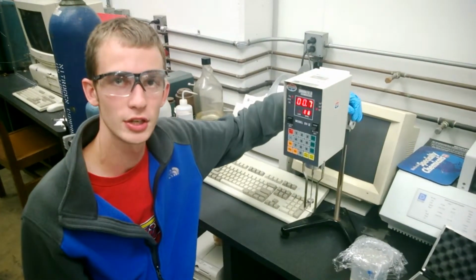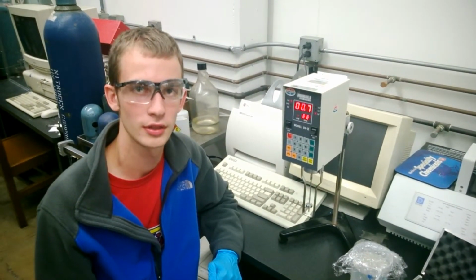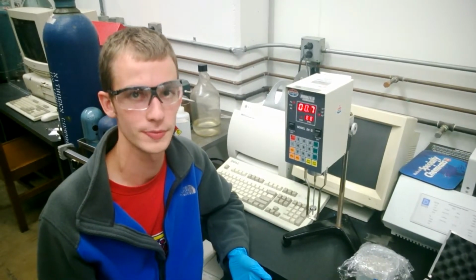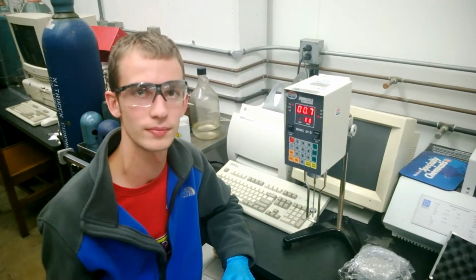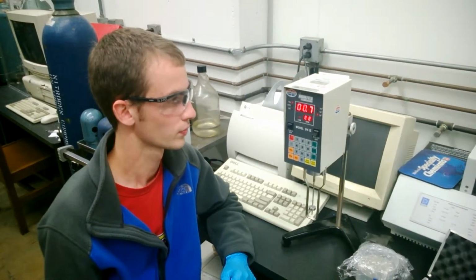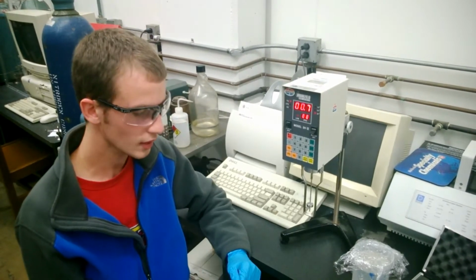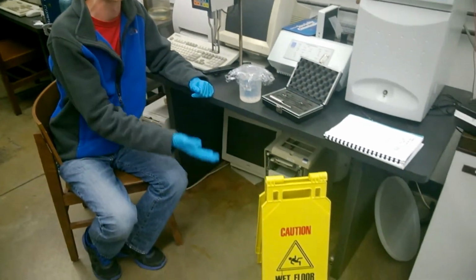Lower the spindle into your beaker of liquid by using the knob in the back. It's important that after you lower the spindle into the liquid, you make sure that there are no bubbles caught beneath the spindle, as this will affect the viscometer reading. After you've ensured that there are no bubbles beneath the spindle, you turn the motor on and then wait for the reading to stabilize. After the reading is stabilized, you can record the viscosity, turn the motor off, and raise the viscometer back out of the beaker using the knob in the back. And as always, if you spill any liquid, use the mop to wipe it up and place the appropriate sign.